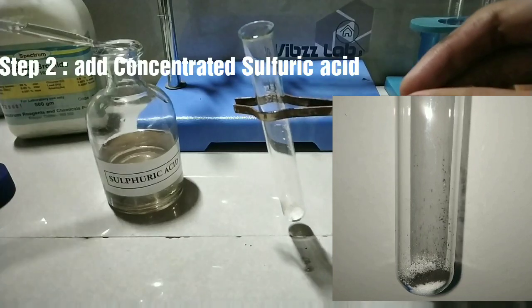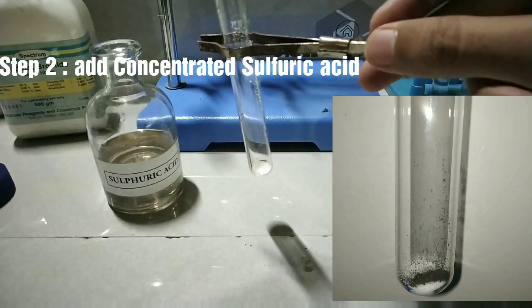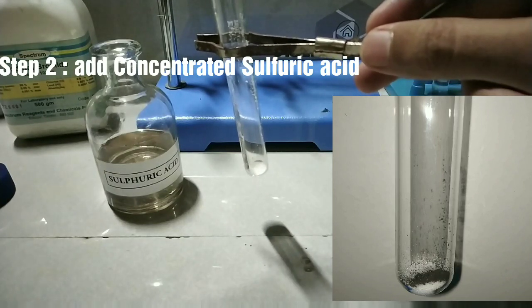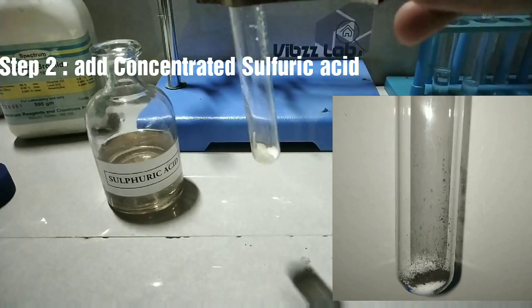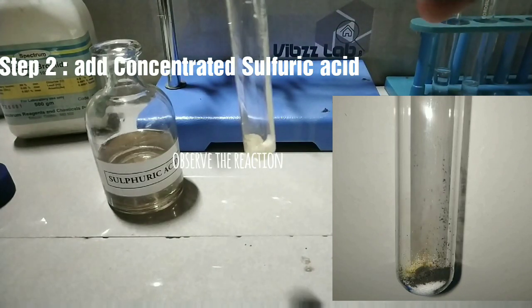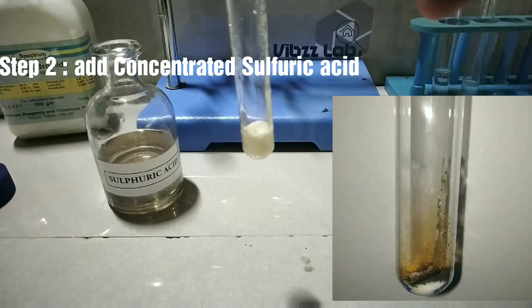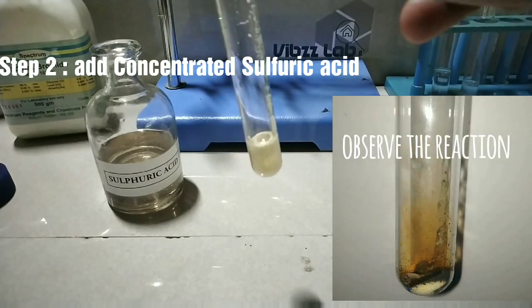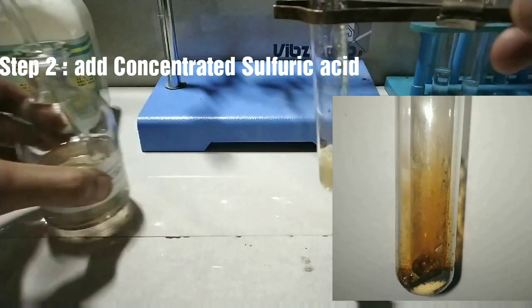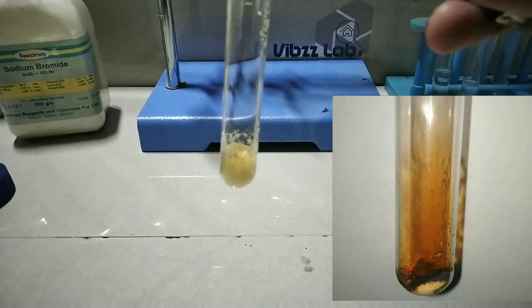The inset video is done in a different way; the actual method is given in the main video. The second step is to add concentrated sulfuric acid into the salt using a dropper, because we should always add concentrated acid dropwise to avoid spillage. Observe the reaction — when I added the acid, you can see that brown colored fumes are being produced.